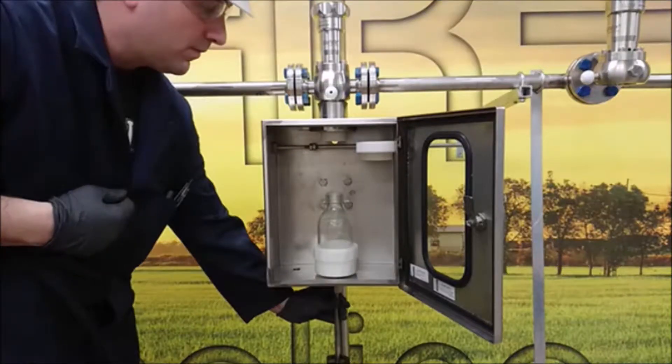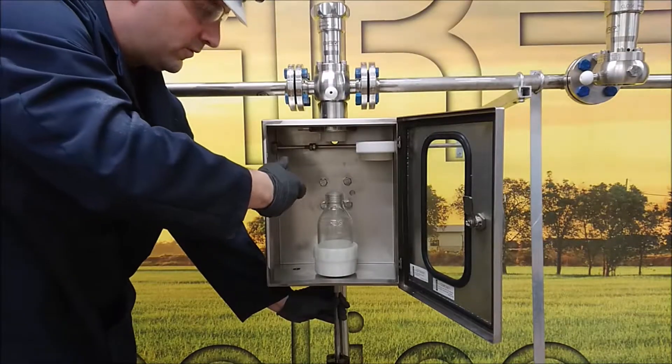At this point, most of the fumes would have been sucked out through the vent connection on the valve. If there are still some fumes remaining, he can see them in the cabinet through the door.